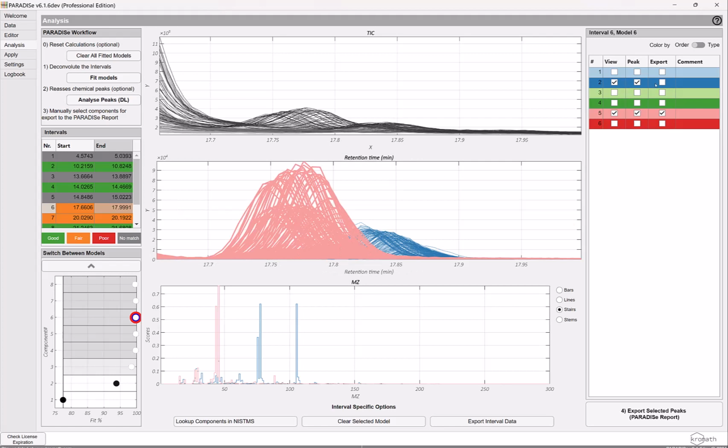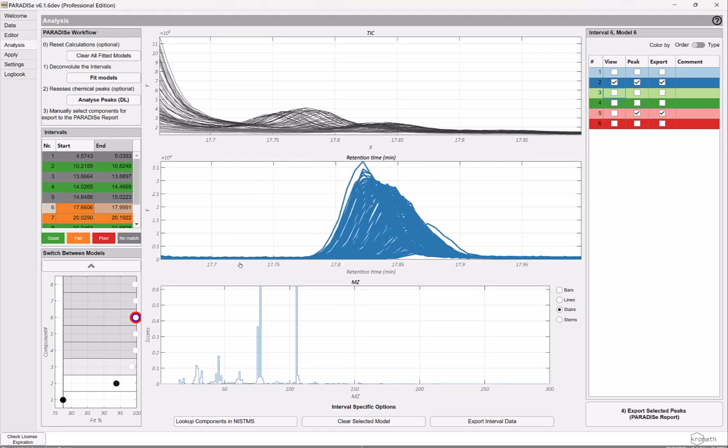these 2 peaks here. Again, they're not completely overlapped, but they're pretty overlapped, and we can nicely separate them from each other. So here we have the other one, completely baseline resolved. And this is not even the most extreme case. You can sometimes find 3, 4, 5 compounds within an interval. So you can really resolve much more than you can with many alternative approaches.